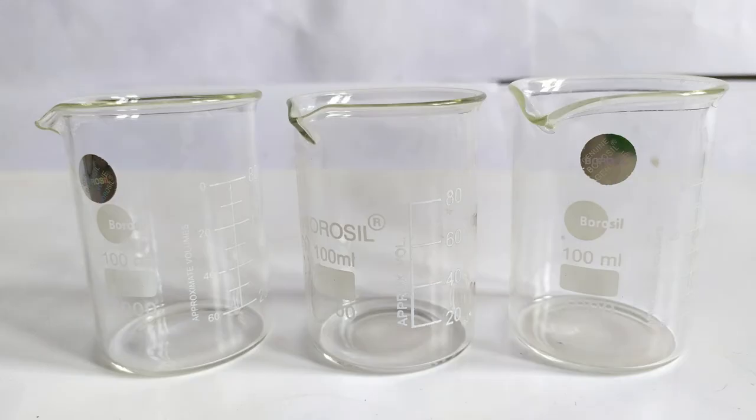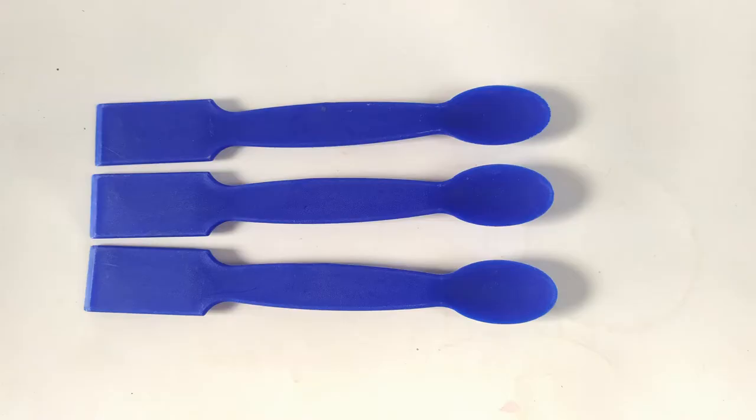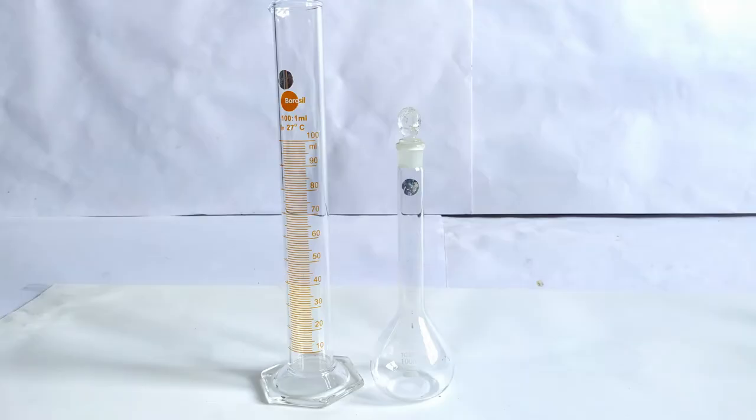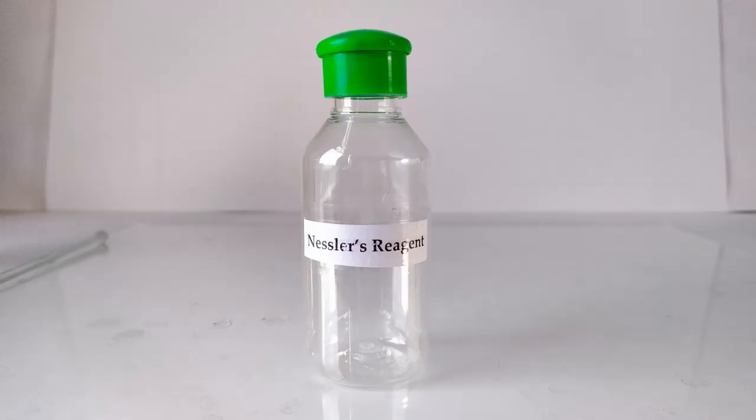You'll also need three beakers of 100 ml capacity, a stirring rod, spatulas, a 100 ml volumetric flask or graduated cylinder, and a suitable container with tight-fitting caps for storage of the prepared reagent.